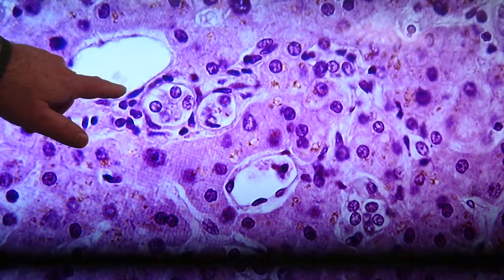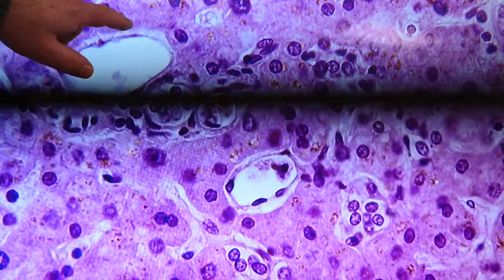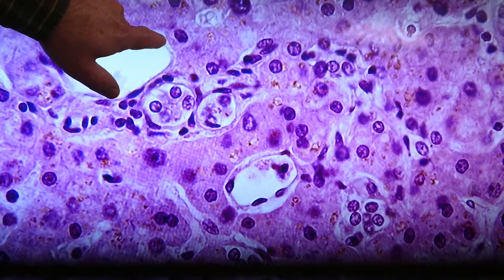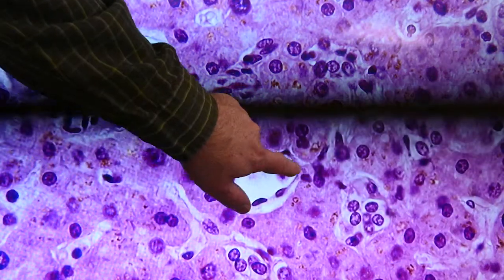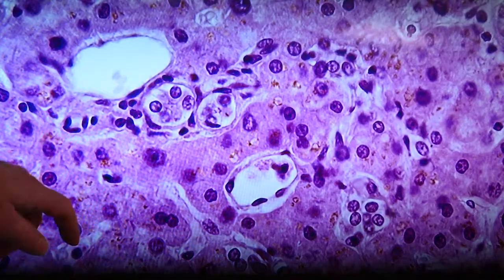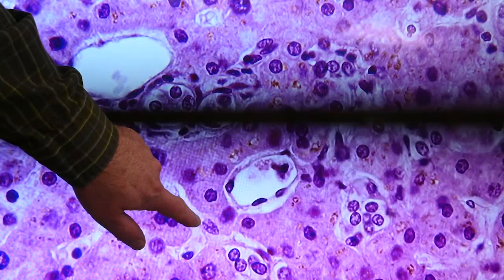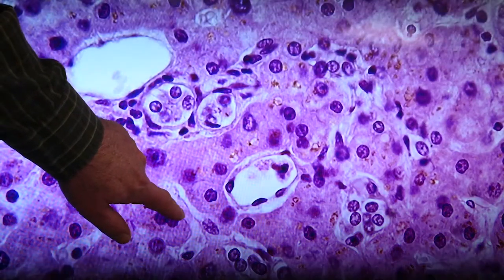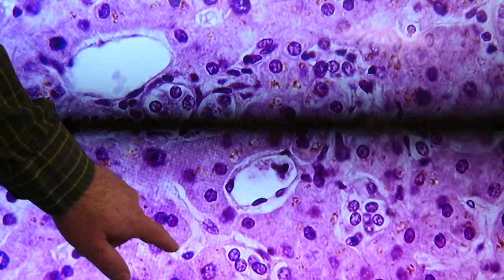So you see an endothelial cell here, some blood cells right inside that sinusoid. That gap between the endothelium and the hepatocyte is that space of Disse. So we have a good space of Disse here and a good space of Disse around that example right there. Down here we have a sinusoid that's kind of collapsed so that the two sides of the wall of the sinusoid form this line down the middle, and the space to either side of that line would be the space of Disse in this example here.